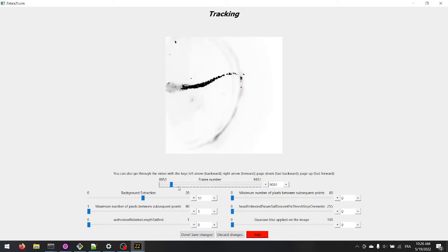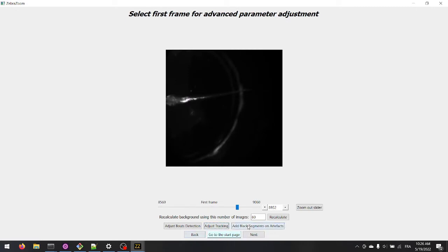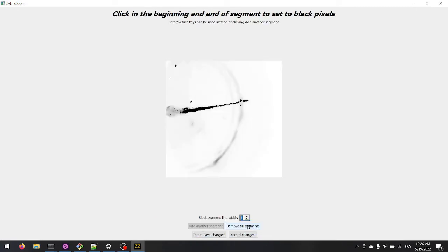A tracking point is still on the ring artifact here. The background subtraction helped improve the tracking, but was not enough. We will thus add a mask on the artifact. Choose the option to add black segments on artifacts.